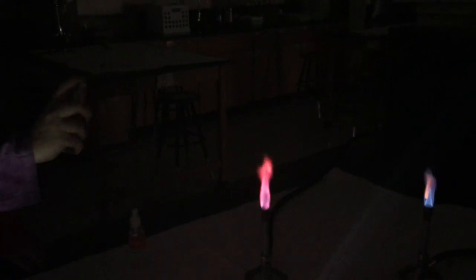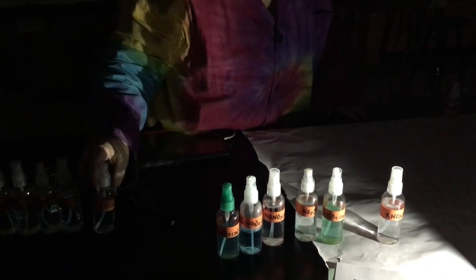All right, so number 5. This is LiCl. Good. Okay. See the direction of the nozzle. Ooh. That was a nice one. LiCl. Number 6. CuCl2. Cool. Ooh.